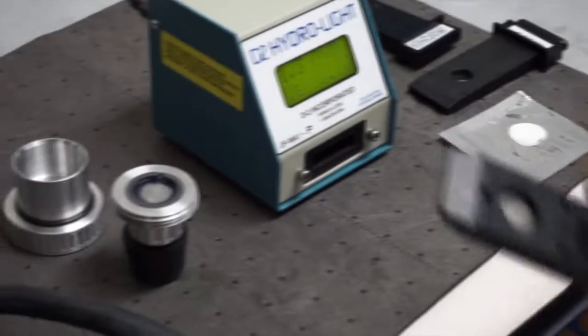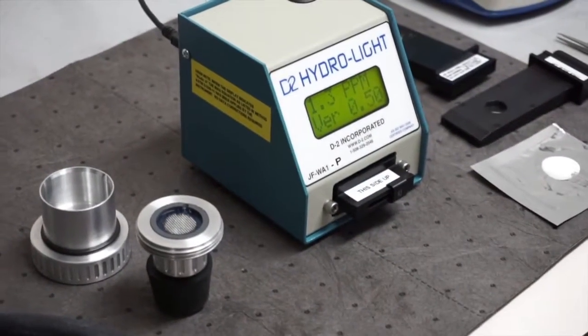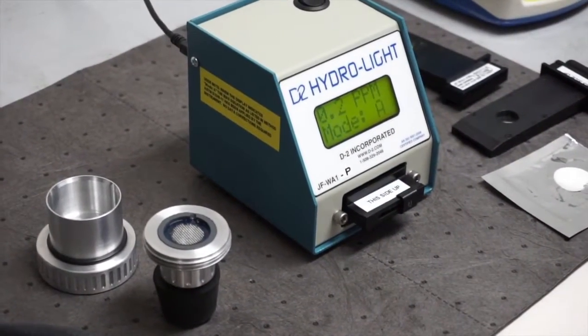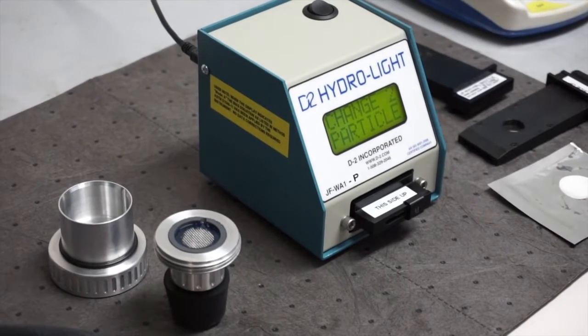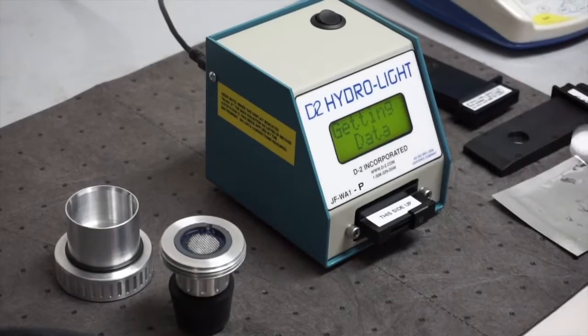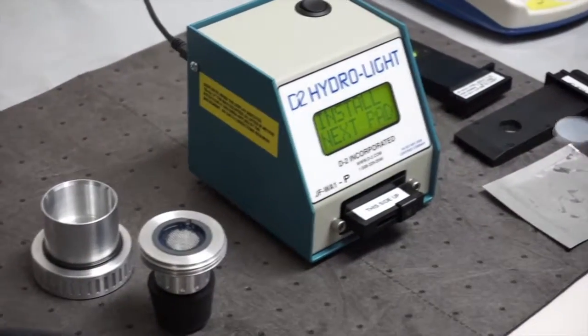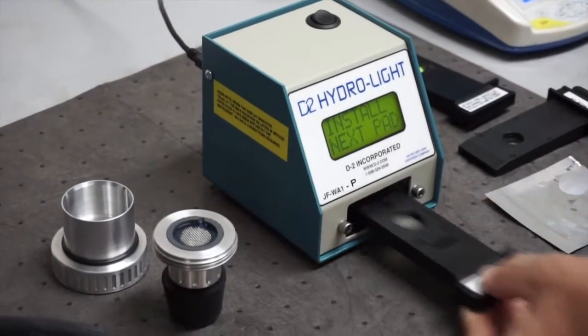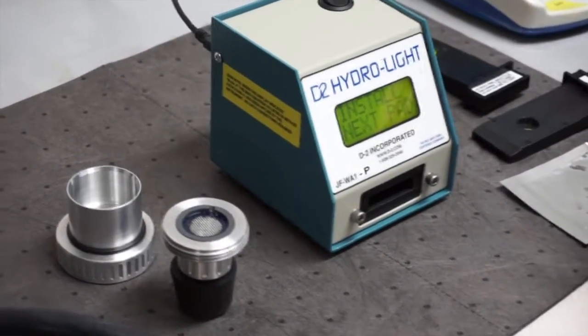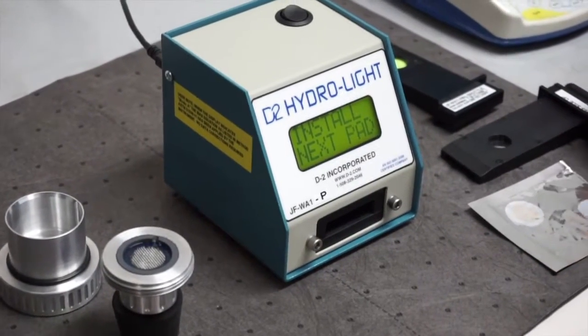So here I just soaked that one pad that we just measured and I'll plug it in. It'll change over to the parts per million measurement. Now the one thing about the instrument is it does like to see the two pads. It'll time out if the second pad isn't installed in a reasonable amount of time, 30 seconds.